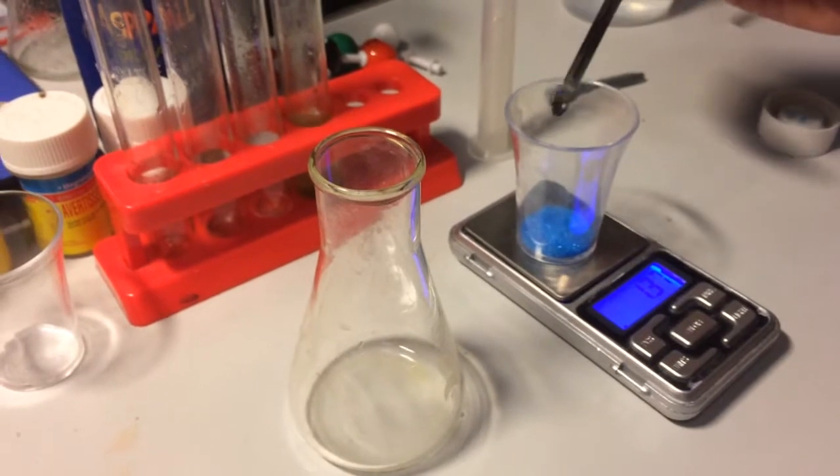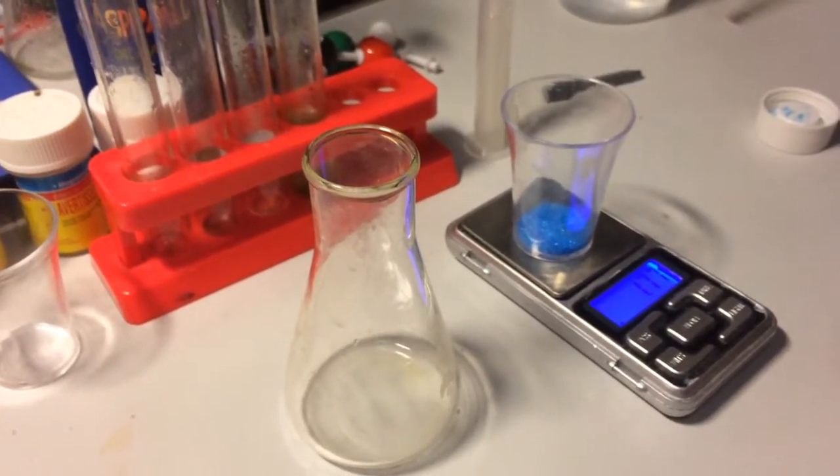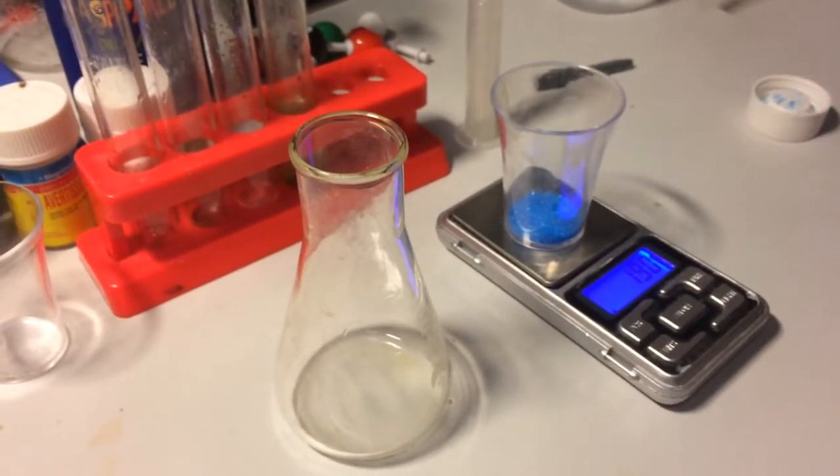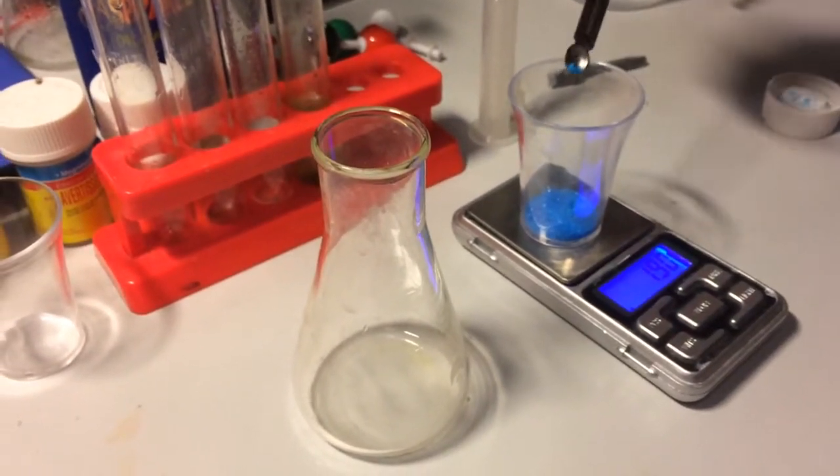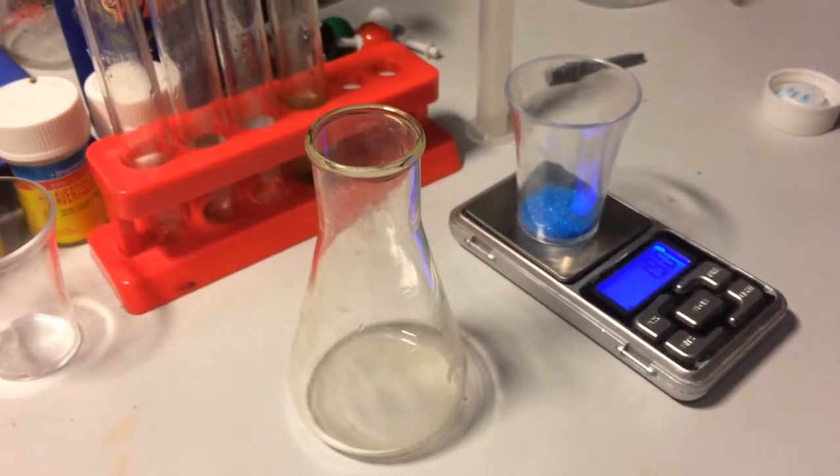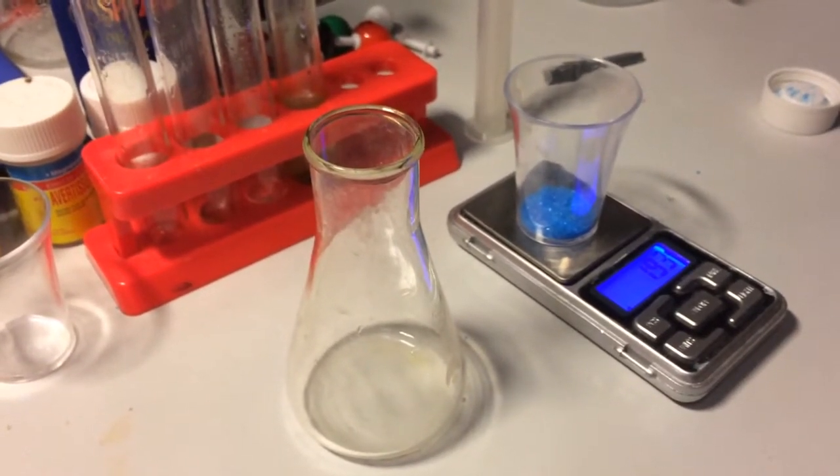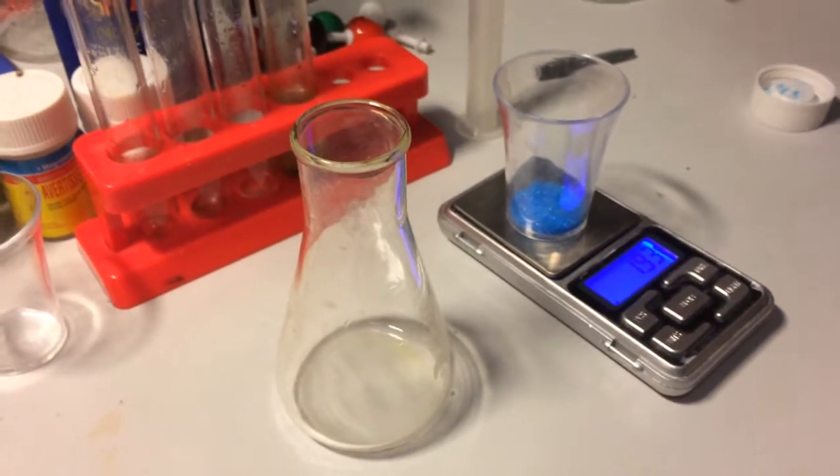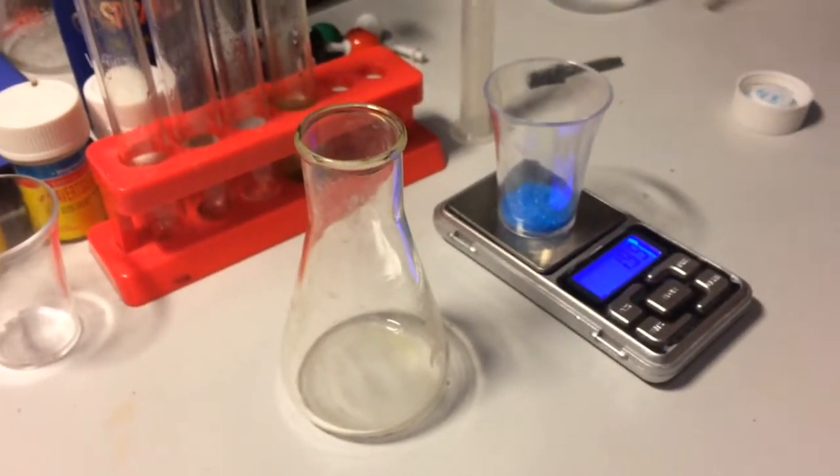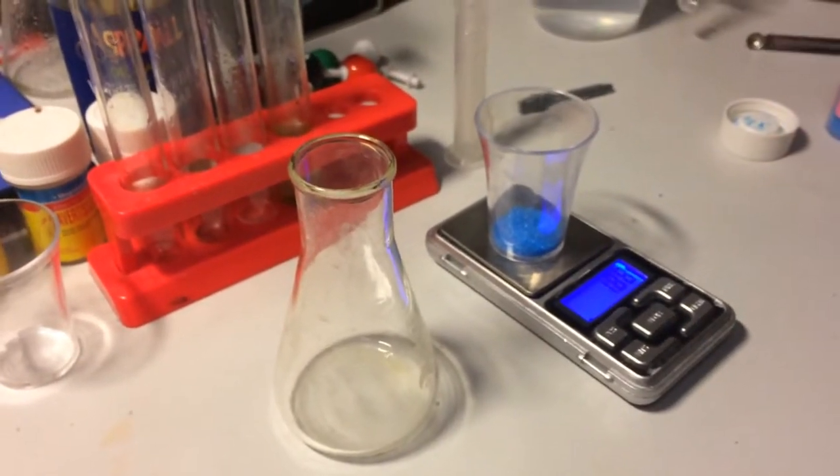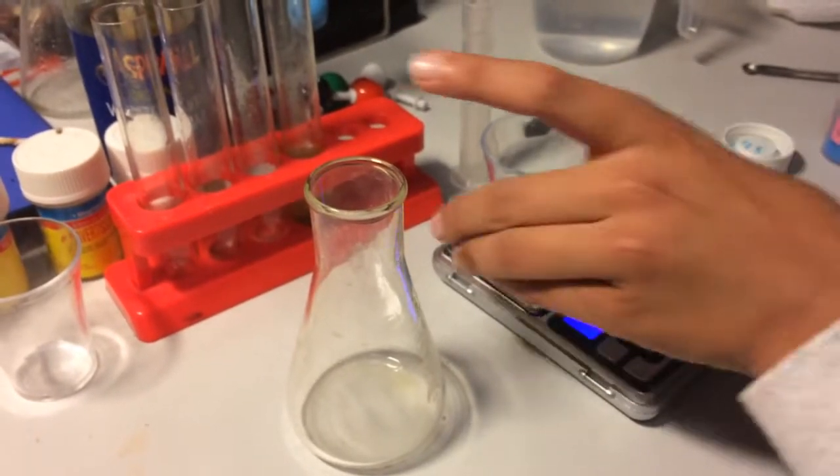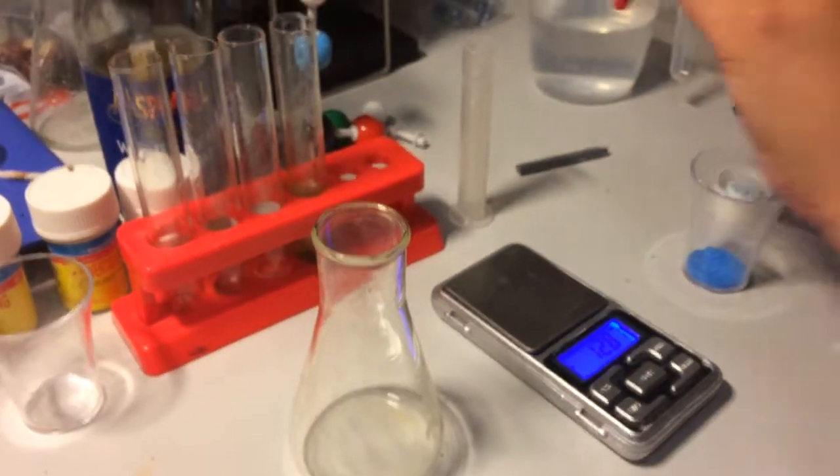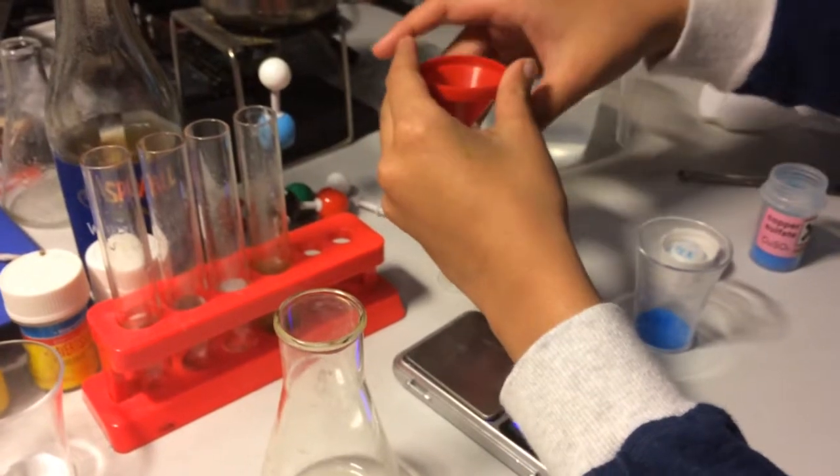Let's go. Now that we have 2 grams, well approximately 2 grams, we can now measure the amount of water we will need, which in this case is 10 milliliters.